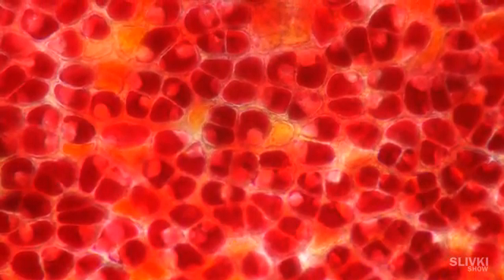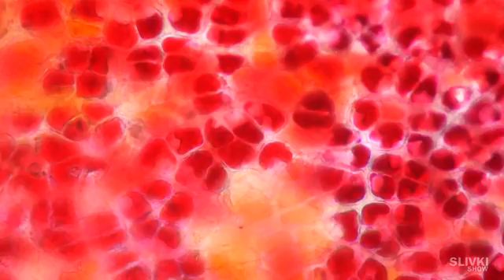Magnified to 400 times — wow! Those are probably some special capsules that contain colored pigments, which probably give the color to the grapes. And apparently these color pigments are liquid, because some of them are in gas bubbles.